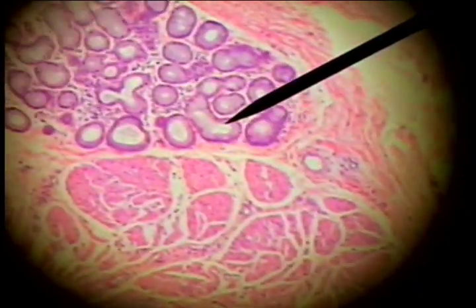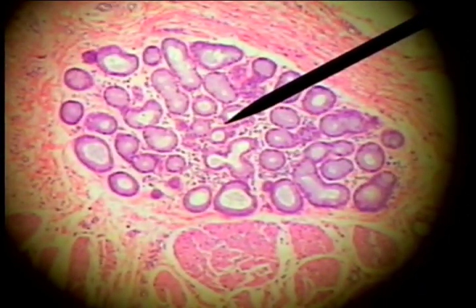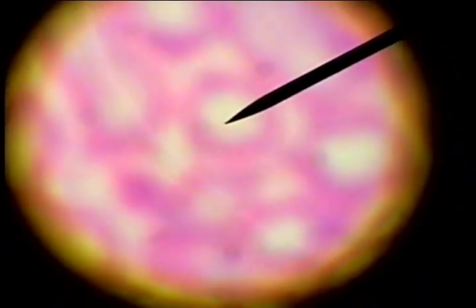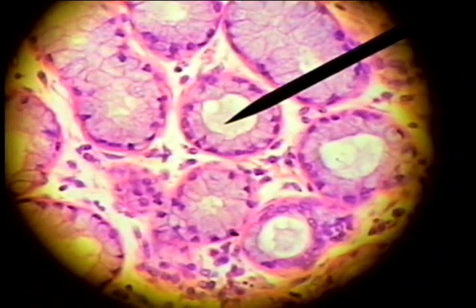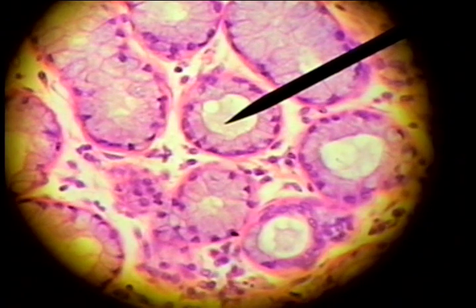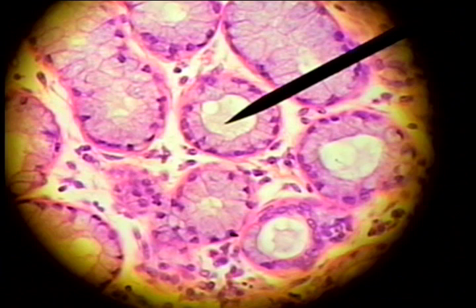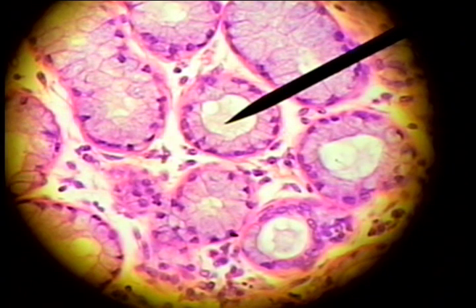In the submucosa, the esophagus has mucus glands to moisten the surface and aid in the movement of digestive material. And here we see the glands that produce a mucus substance to lubricate the esophagus.